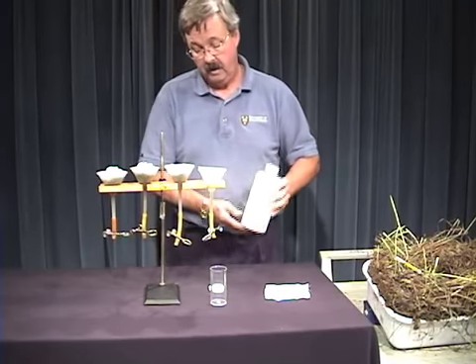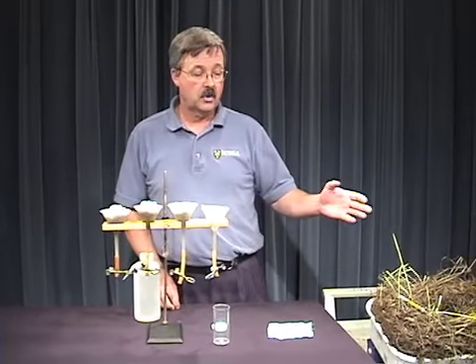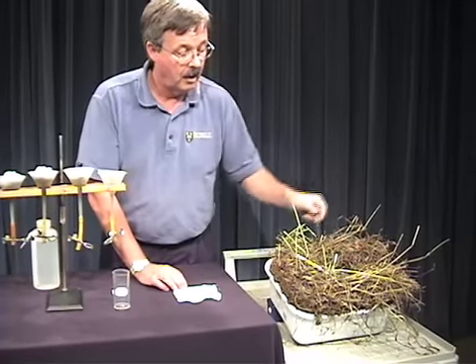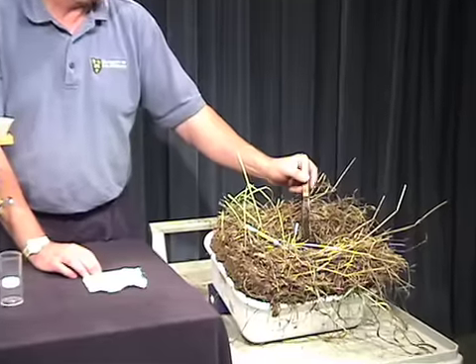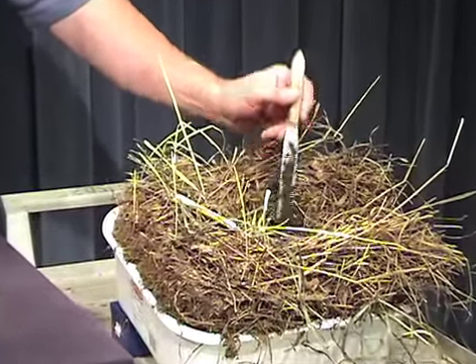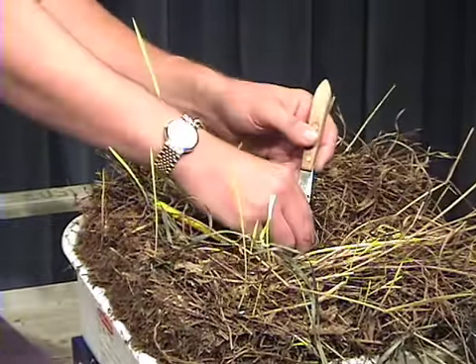Like that. Now I need a soil sample, and I have a soil sample that I brought with me. This sample comes from a grassland. It's undisturbed. It's relatively moist. I took this in midsummer, and so it's a good place to find organisms. So it's high in organic matter, moist, and undisturbed.